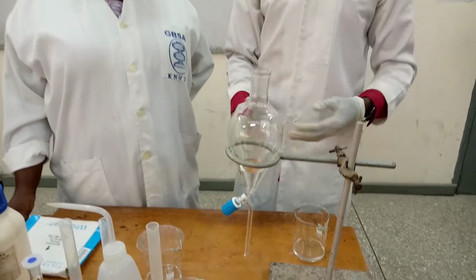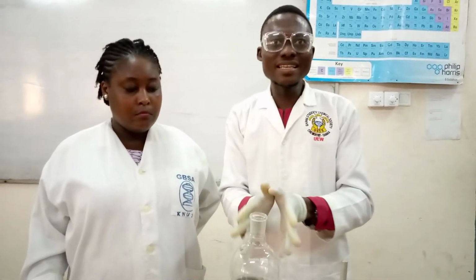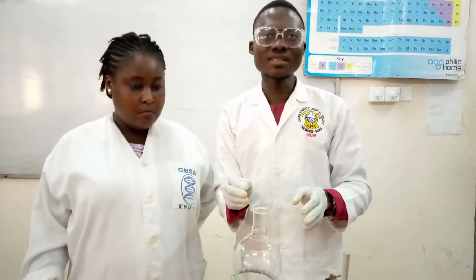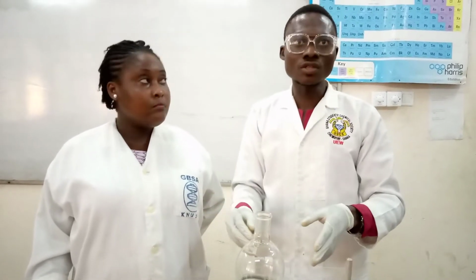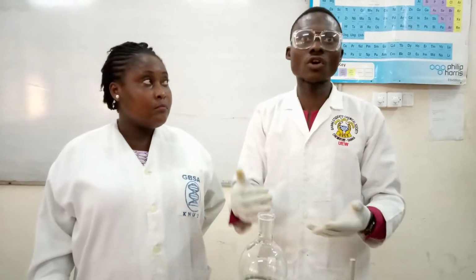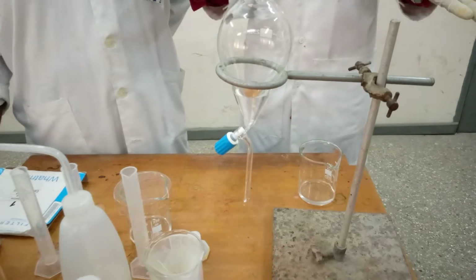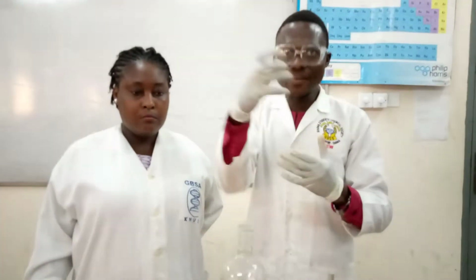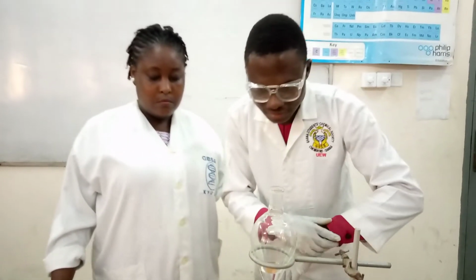And we are doing 2 or 3 extractions because we want to make sure all the benzoic acid in the organic solution has been reacted. That is the main reason. So that we make sure all the benzoic acid in the organic solution will react with the sodium hydroxide. We want to make sure we take it all. Okay. So that what will be left will be only the neutral compound, that is the naphthalene. That's the main reason why we are doing the extractions 2 or 3 times, just to make sure that all the benzoic acid has been taken out of the organic solution.